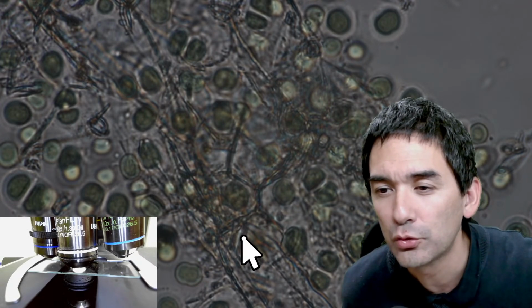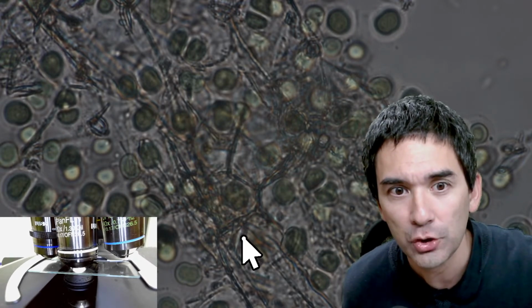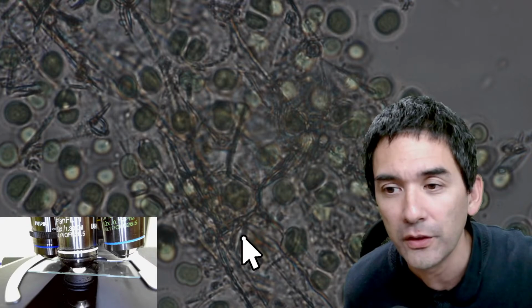I try to use them dry. Well, generally, if you use the oil lenses without oil, then they should be blurrier than if you use them with oil.